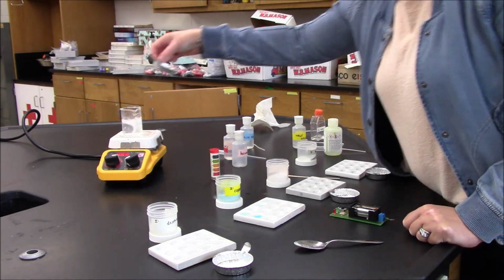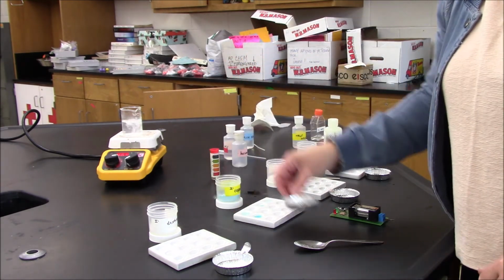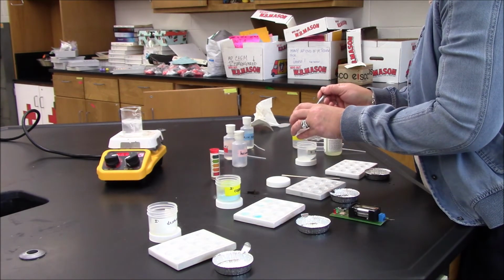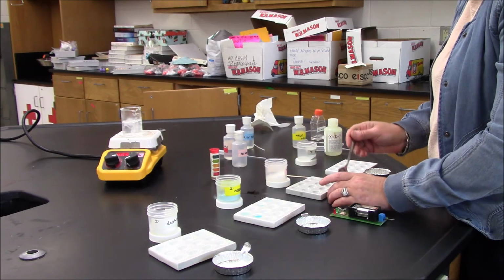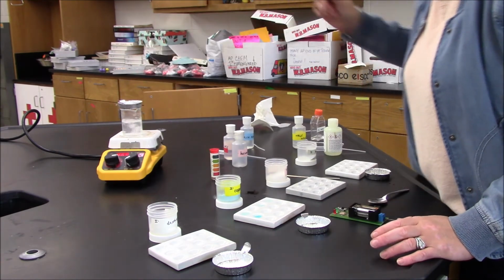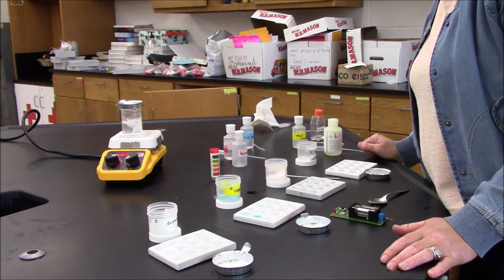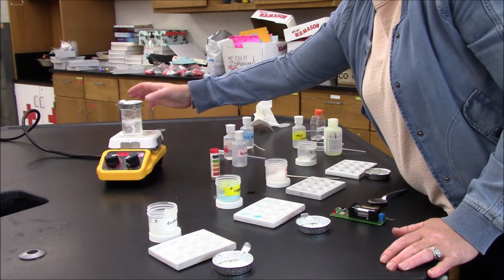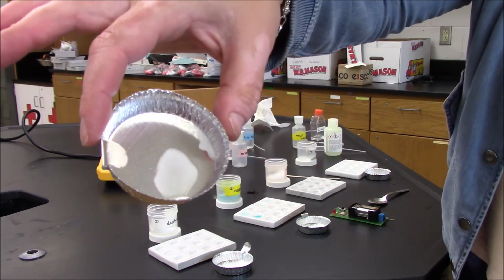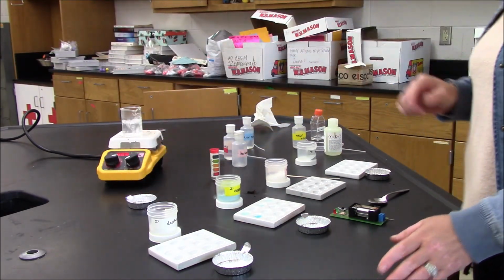I'm going to go on and check its melting point, but you can see here for copper 2 sulfate, nothing has happened. So its melting point is definitely greater than 100 degrees Celsius. I'll add a few of the pellets of wax. And I don't even have to wait, it's already melting. You can see it's melted. So this clearly melts at a temperature that's less than 100 degrees Celsius.